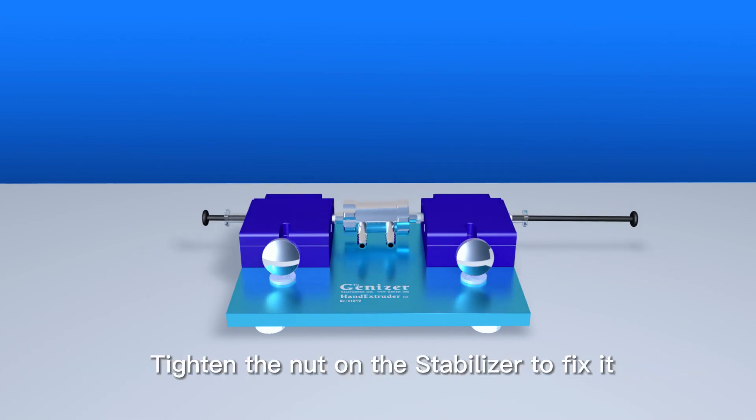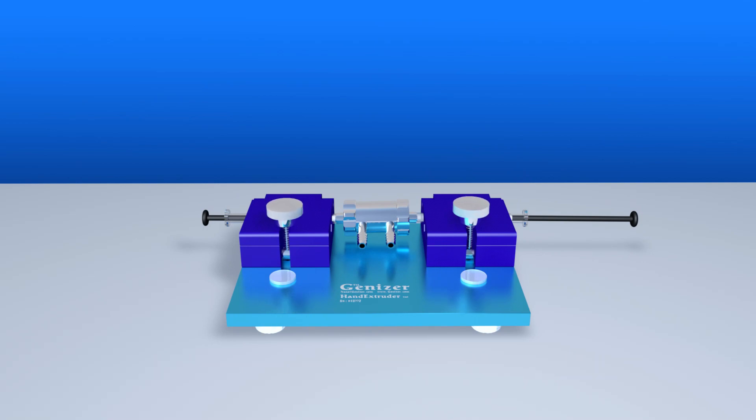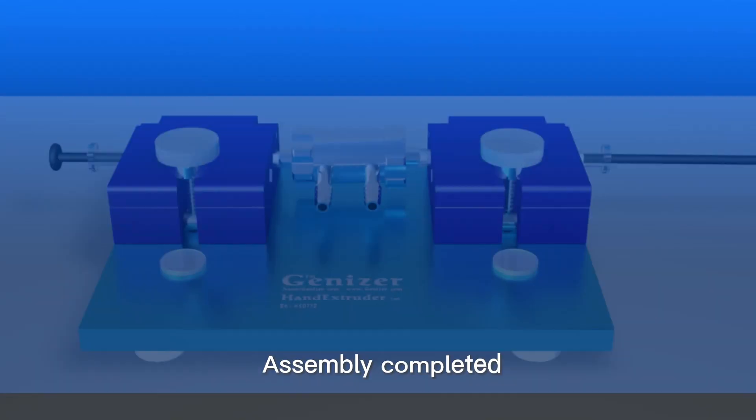Put on the plastic top cover. Tighten the nut on the stabilizer to fix it. Assembly completed.